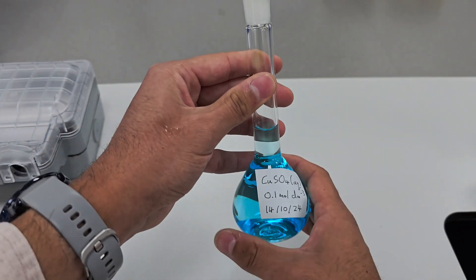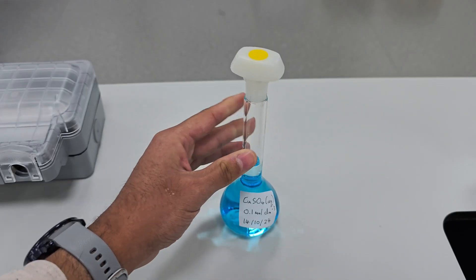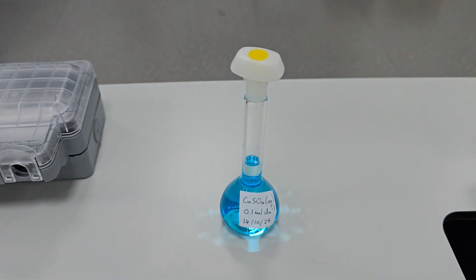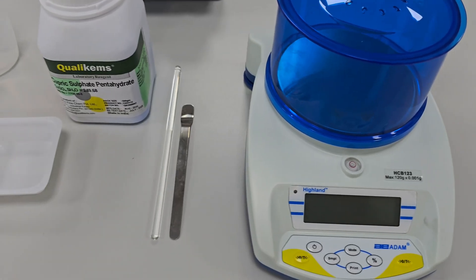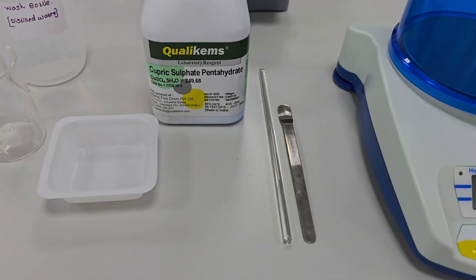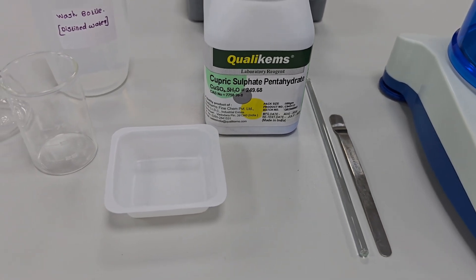And that's how you prepare a standard solution of 0.1 mole per decimetre cubed copper sulfate. This method is fundamental for titrations and many other experiments in IB chemistry.